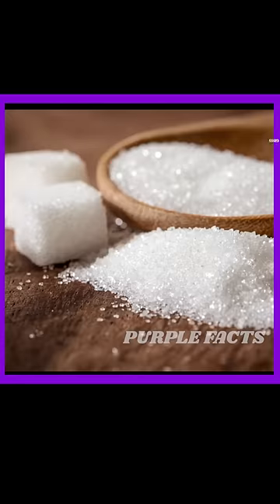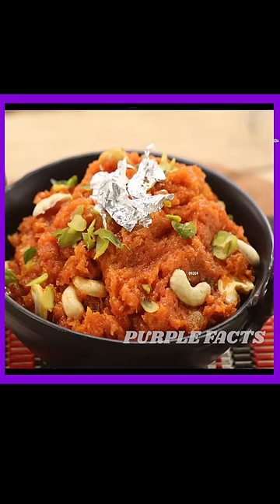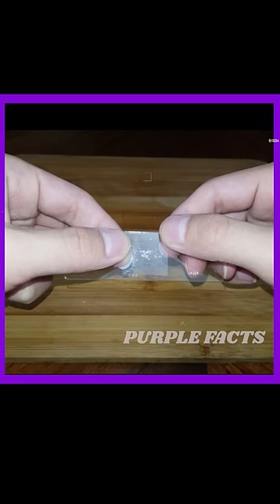2. Sugar. If you use it in the microscope, there are crystals visible in the microscope.